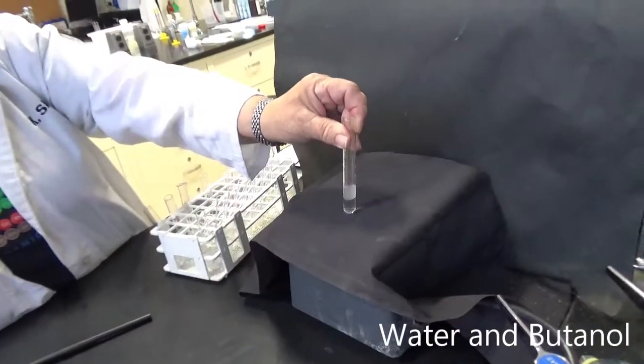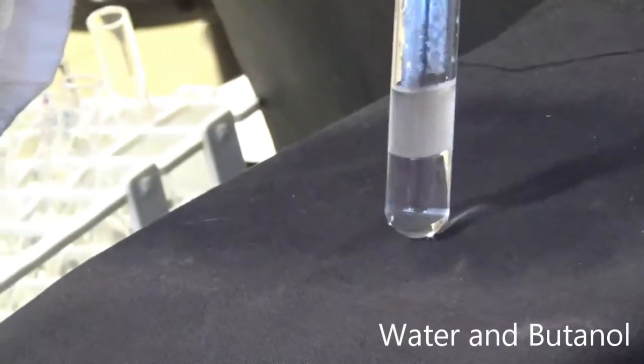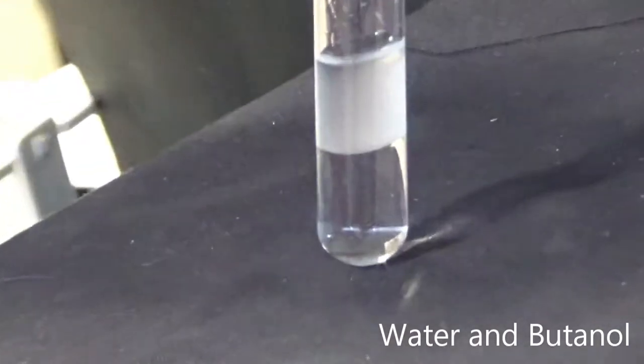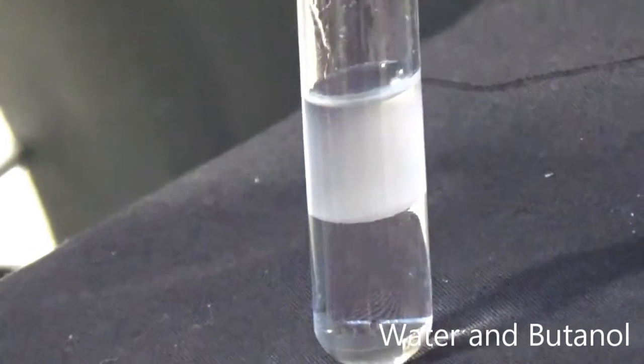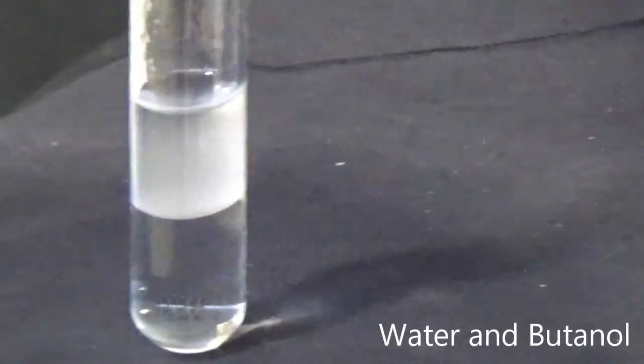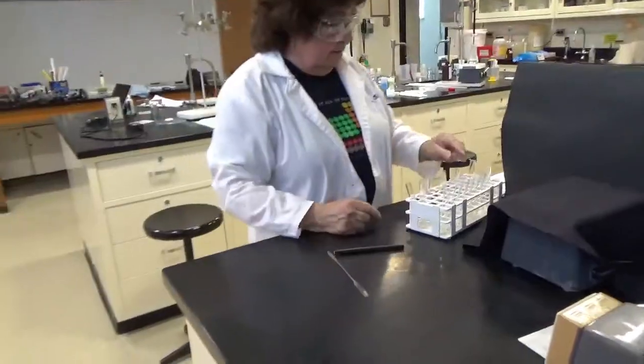Okay. Let's see what happens here. What do you observe? And let's see how it settles out. Is there one layer? Is there two layers?